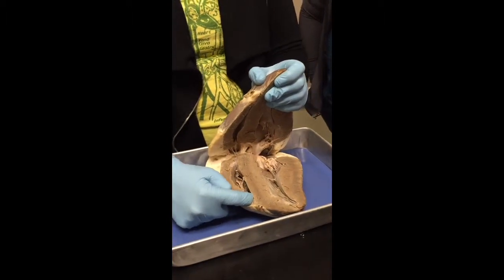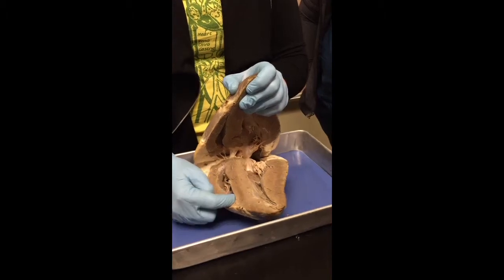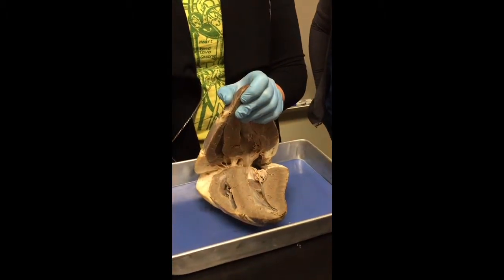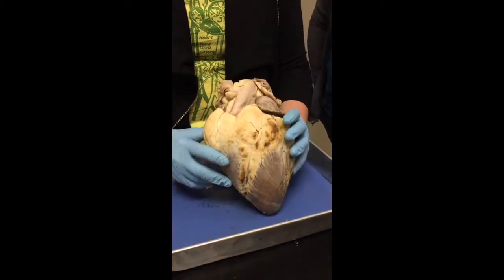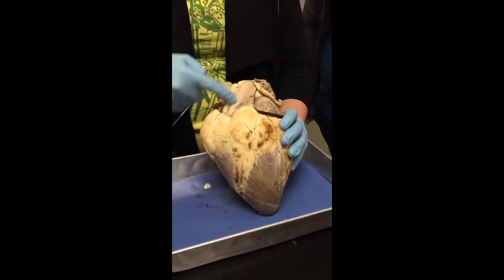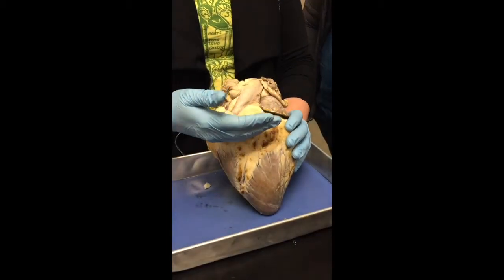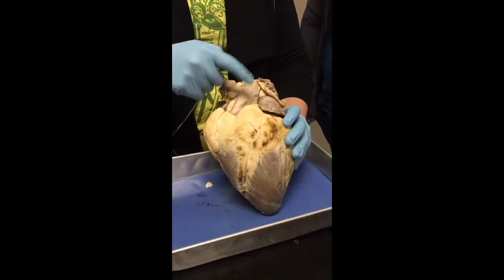The ventricles contract. The blood is going to go up and out through the pulmonary semilunar valve, which you can't see on here, but you can see on the models, through the pulmonary trunk, right? Here's the pulmonary trunk right here. This is that large vessel on the anterior part of the heart that's slanted at a diagonal. Pulmonary trunk.